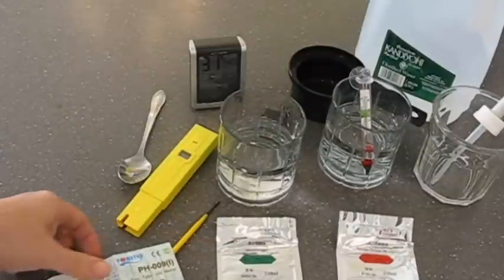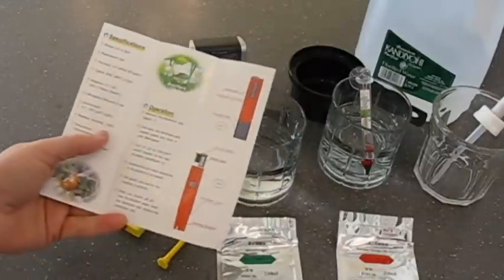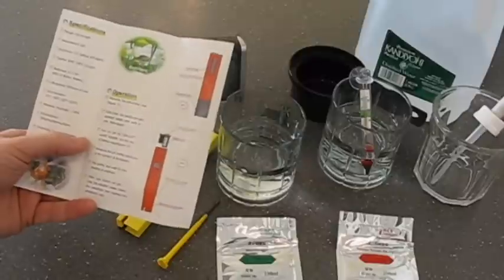But it's important according to the directions that apparently were translated from Chinese and so they're kind of difficult to follow. They were written by a non-English speaker, it would seem.